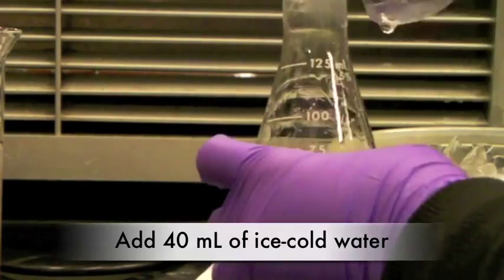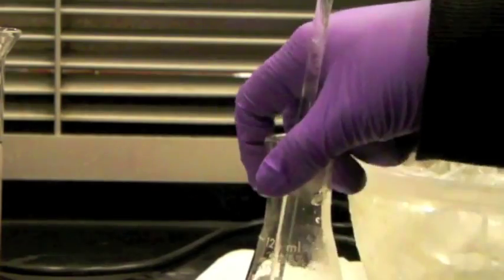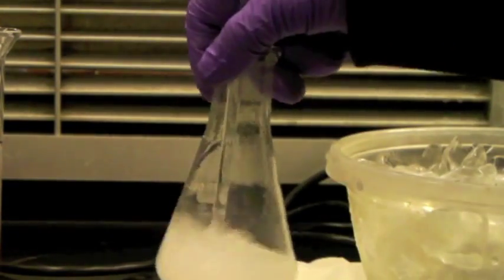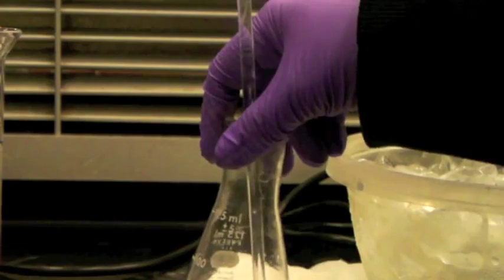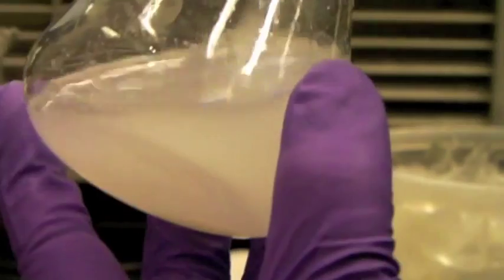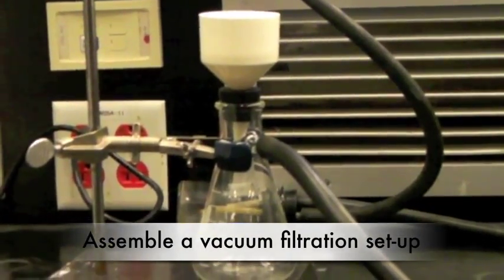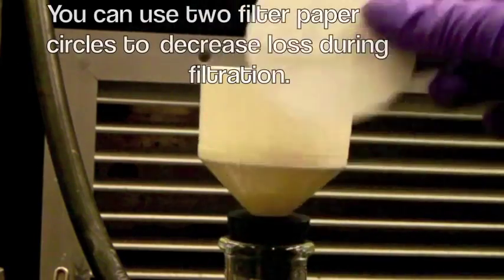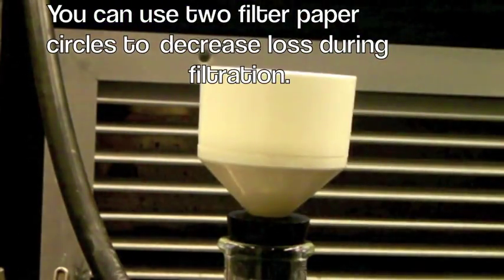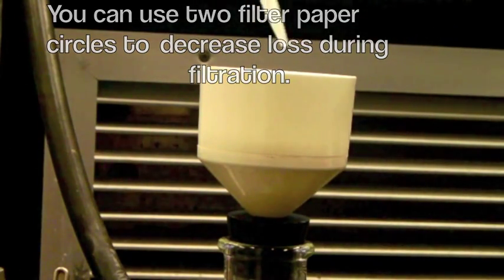Add 40 ml of ice-cold water. Place the flask in the ice water bath for 5 minutes. Now we're ready to start filtrating our solution. Using 2 circles of filter paper instead of 1 can help decrease loss during filtration. Remember, we're trying to get the highest yield possible.